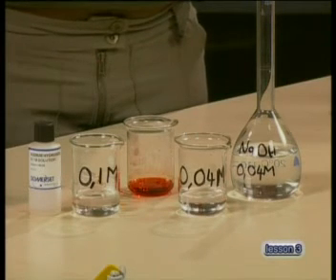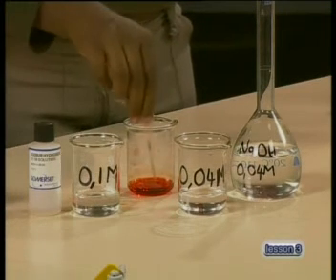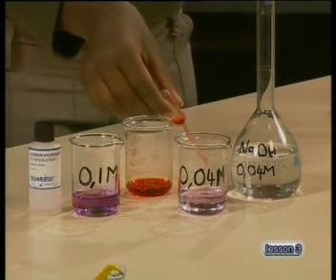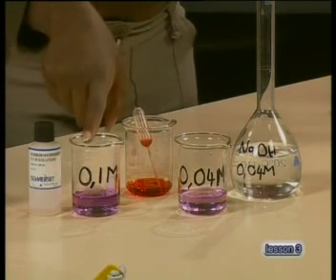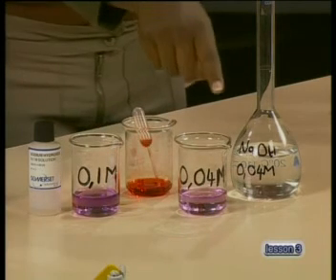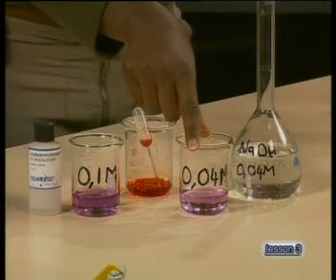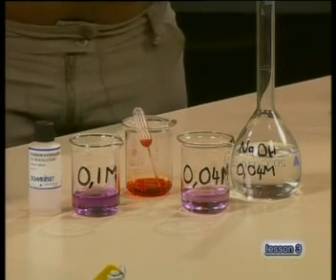Let's take a look at how sensitive this universal indicator actually is. I'm going to add a few drops to each sample of the sodium hydroxide solutions I prepared earlier. The 0.1 molar solution has turned a darker purple, while the 0.04 molar solution is a lighter purple. This color change gives us a way of measuring small changes in acidity, and this indicator is the tool we can use to develop a range of different levels of acidity.